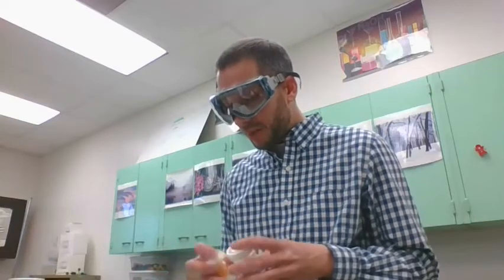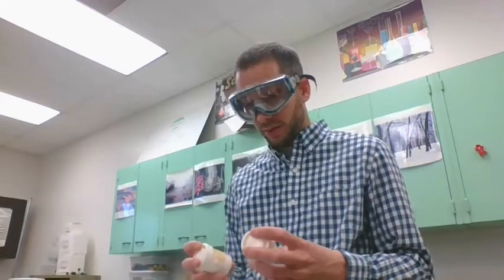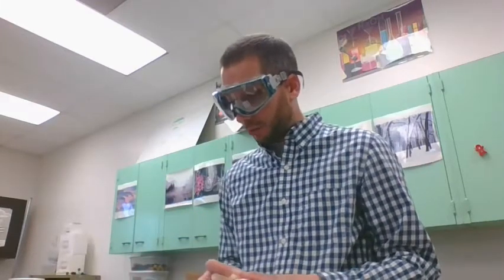Pb(NO3)2 and KI. So these are going to react. What we're going to get out of here is one solid product and one liquid. The solid is going to be lead iodide, which is PbI2. We're going to try and see how much of that lead iodide we make. When we do the lab, we'll be able to record and see how close we get to that.